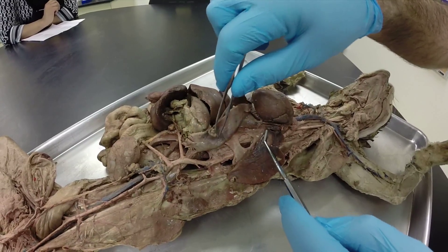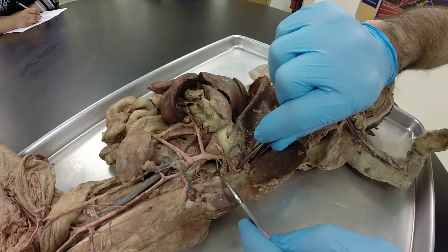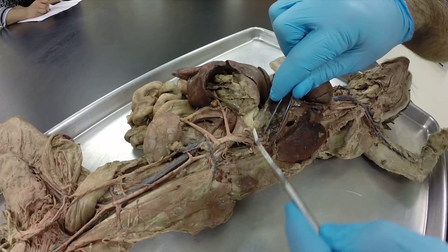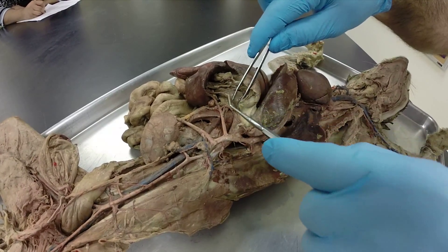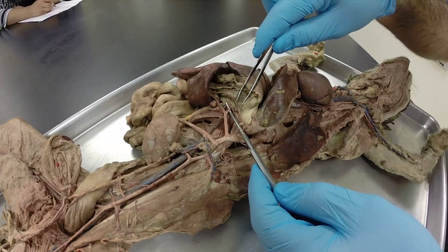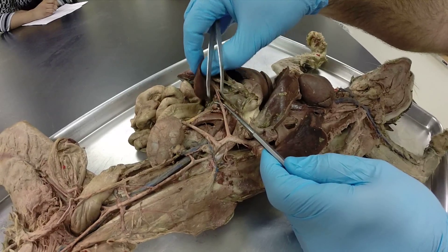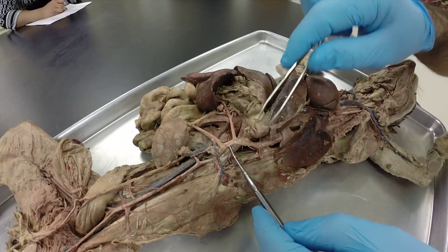Back in the thoracic cavity, this is again our descending thoracic aorta. Where it passes through the diaphragm, we now call it the descending abdominal aorta. The first branch off the descending abdominal aorta is the celiac artery, which has three main branches: the hepatic artery, the gastric artery, and the splenic artery. The splenic artery may branch several more times going to the spleen.